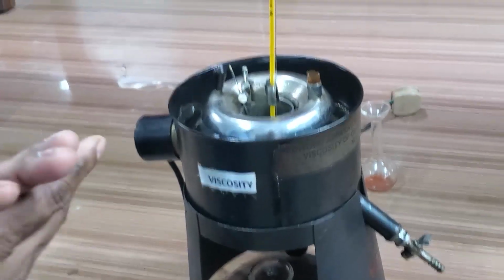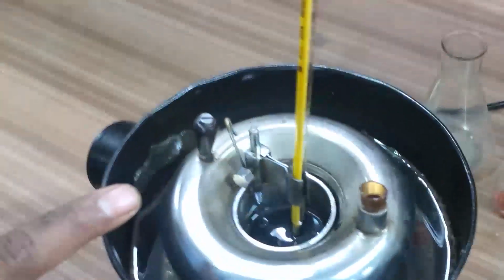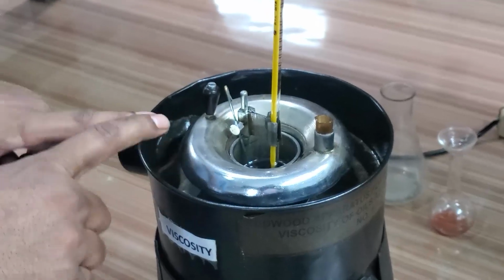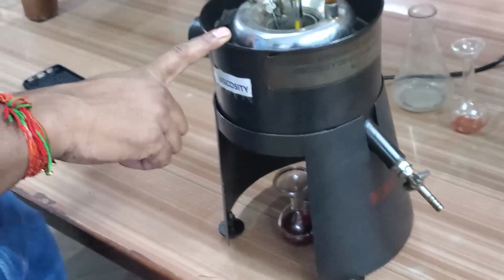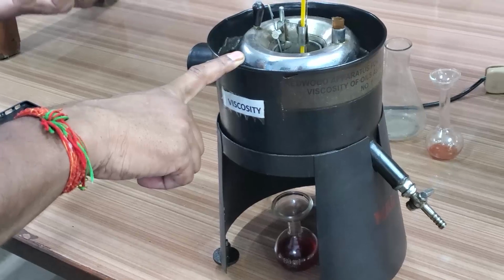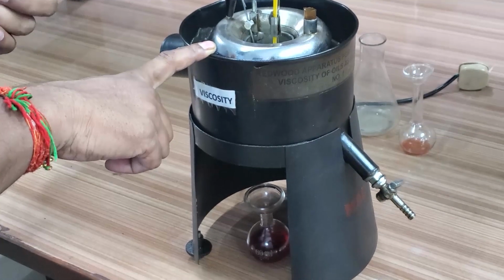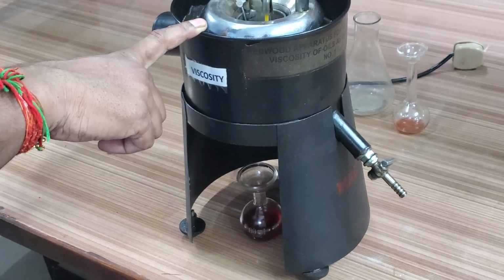We take that time at different temperatures, because the heater setup is also there; at whatever temperature you want, you can measure the time of flow of that fluid into the 50cc bottle. From this we can find the kinematic viscosity of the fluid. Kinematic viscosity is the viscometer apparatus factor multiplied by the time in seconds, the time taken to fill that 50cc bottle.